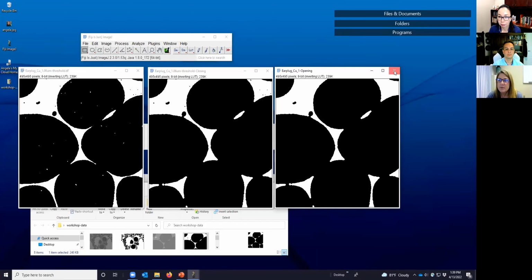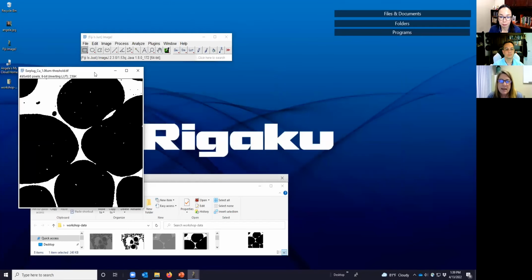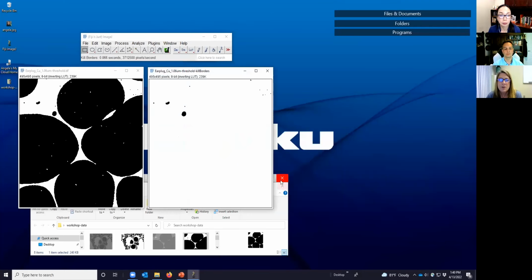All right, so let's look at a couple of other filters. So in this case, we're going to use, let's say this one for the first one, and we're going to go to Morphological filtering. And on the bottom of this list, you're going to see kill borders and fill holes. So if we say we want to kill borders for this image, then what we see is we get rid of most of them, right? Because our voids, many of them are intersecting, with exception these really tiny ones in here.